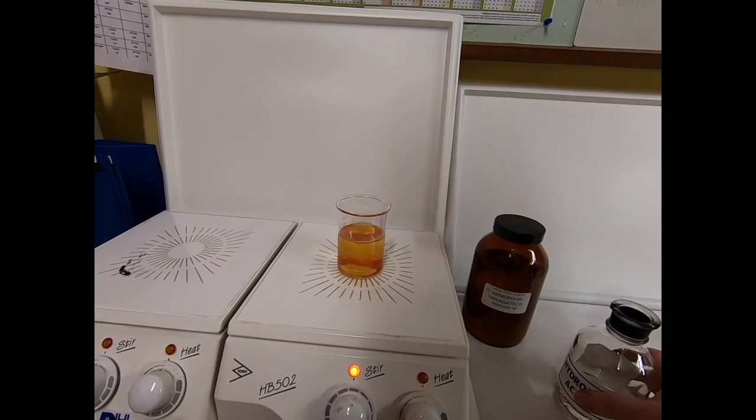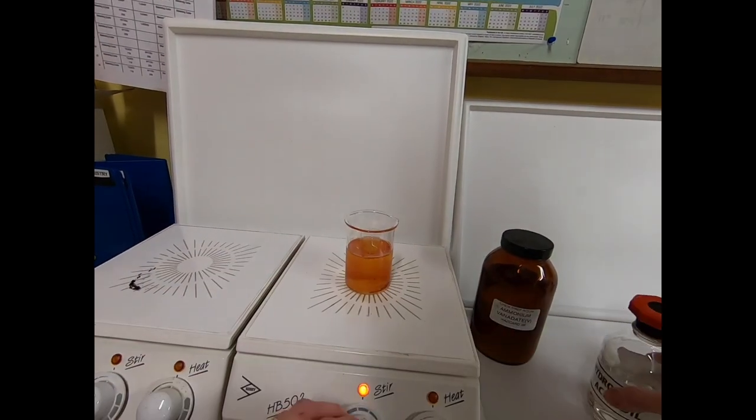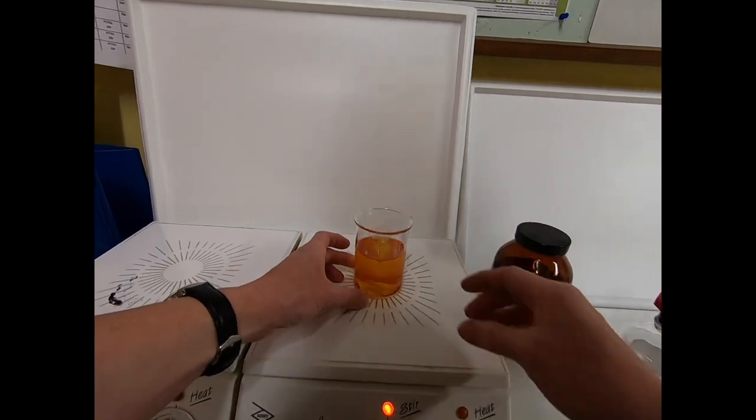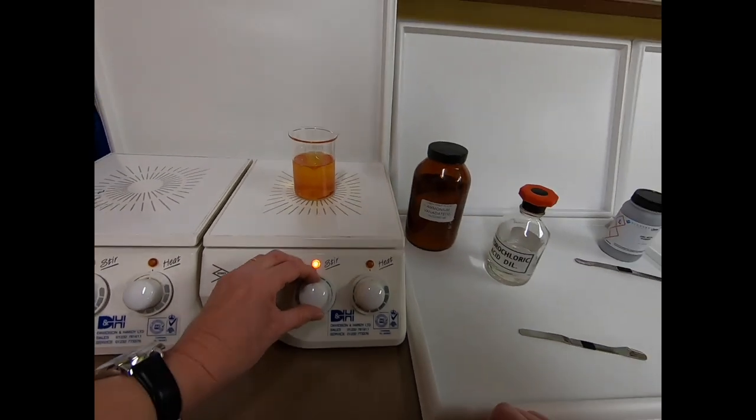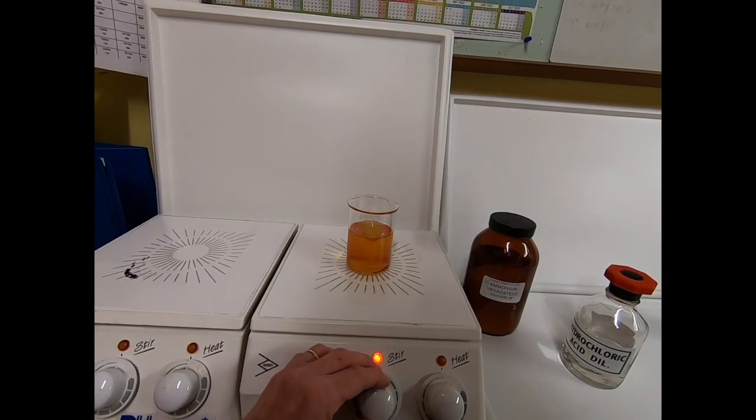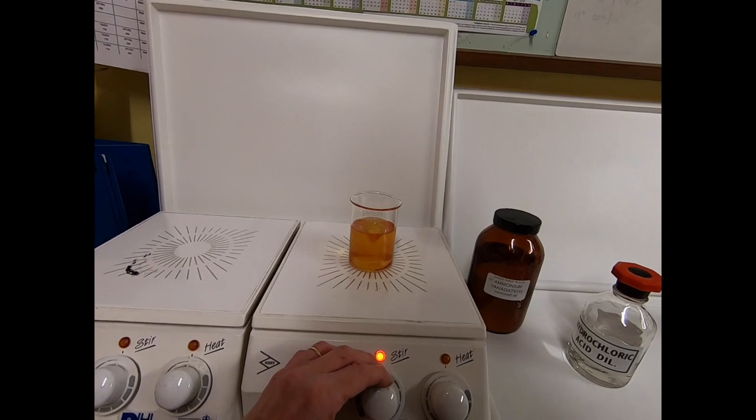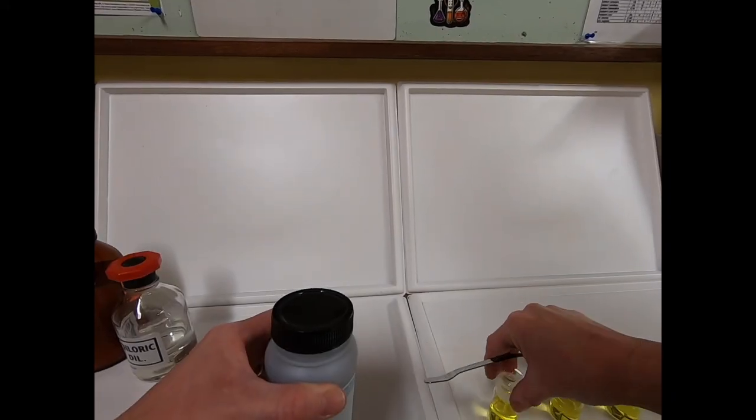Sulfuric acid cannot be used in this case because it could be reduced. The sulfur's oxidation number in sulfuric acid is +6, but it could be reduced to +4, +2, 0, or -2.